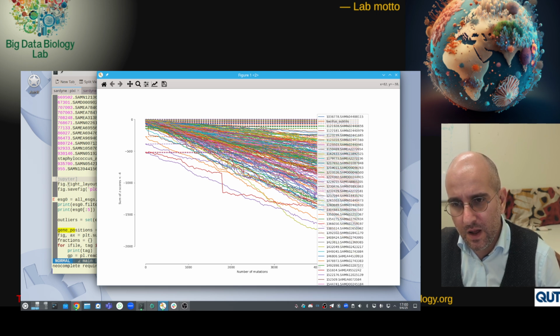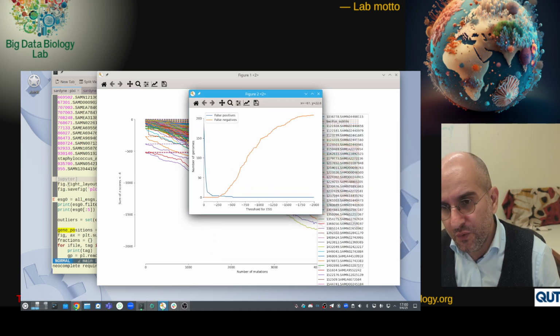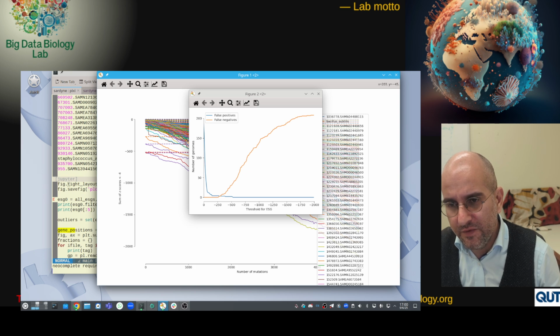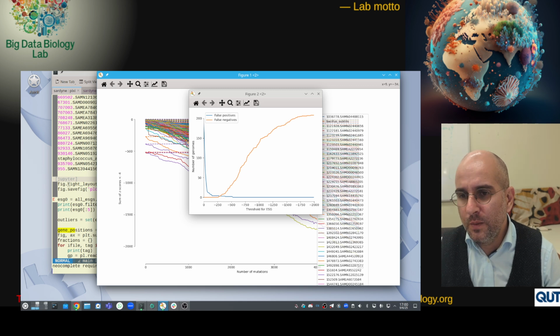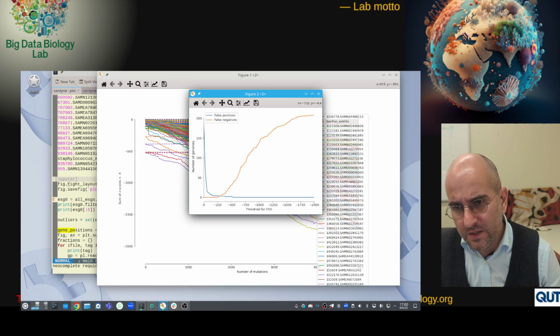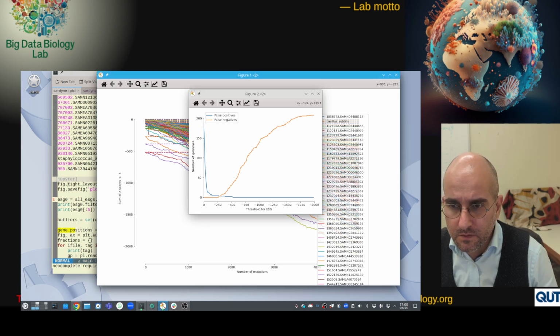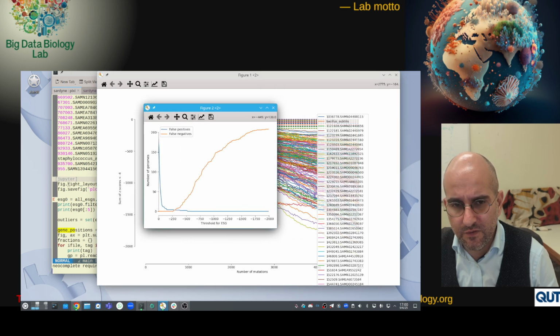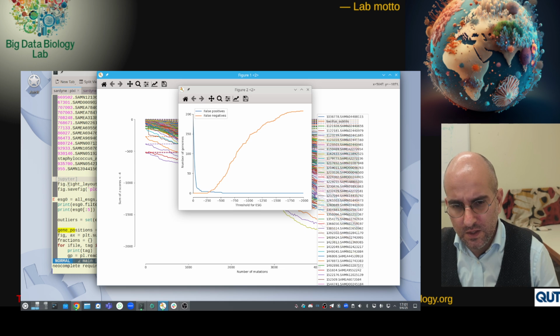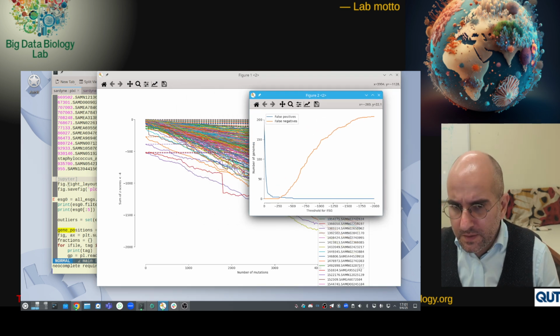Ideally all of the dashed lines would be up here, and all of the full lines would go down, and we would be able to find the threshold. This is what we looked at two weeks ago. If we threshold right here and say that everything below this is a bad genome, then we have a lot of false positives. As we move this threshold, say here, we still have a handful of 4 false positives, but except for these 4, we have very few false negatives. So we're mostly catching everything. If the threshold is too low, then even genomes where we've added 5,000 mutations would still not be caught. So this is already quite good.